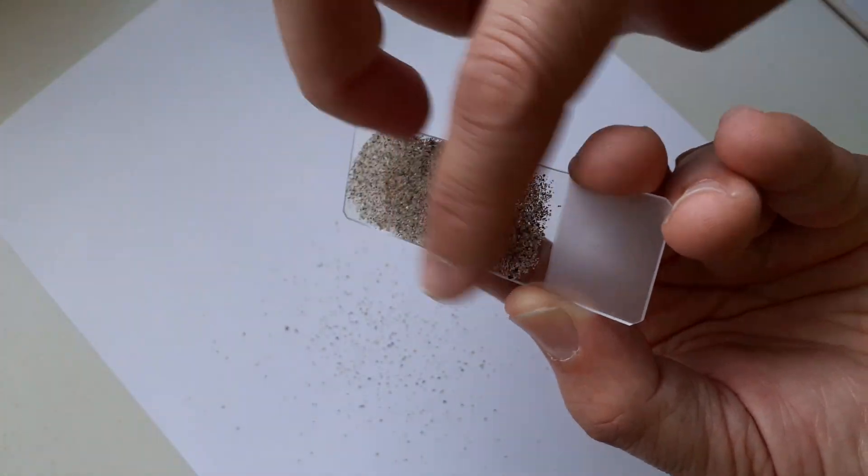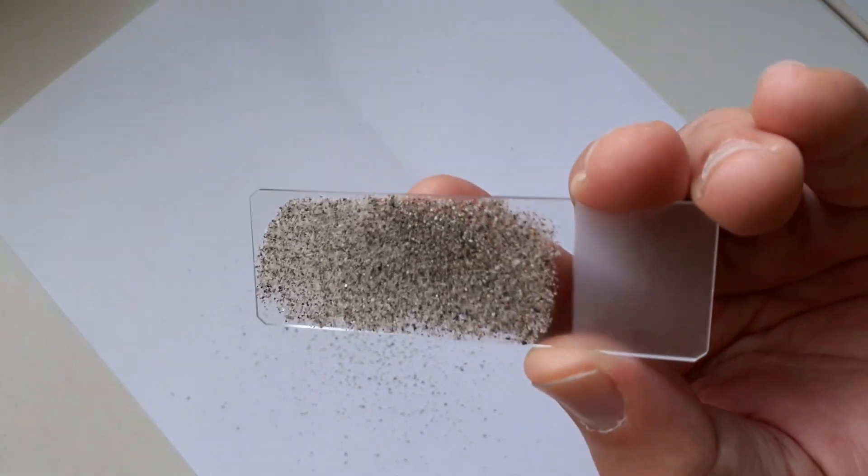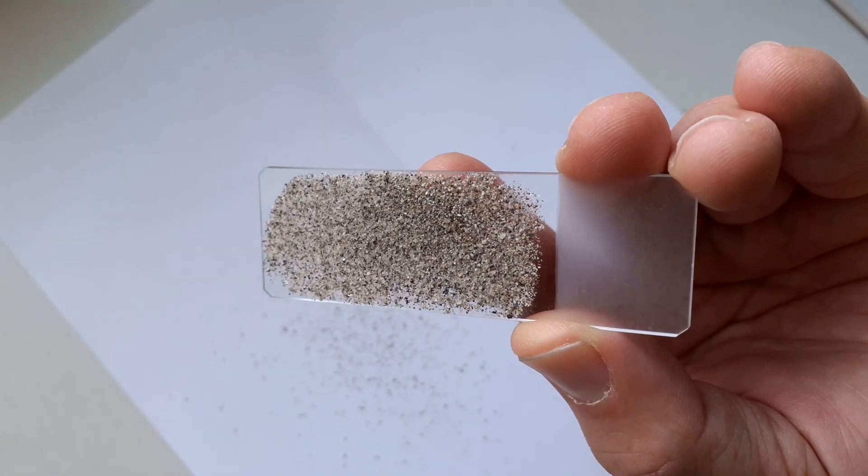So this is now after the drying time I was able to remove some of the sand. Yeah and it worked quite well, so I can imagine quite well that this is able to last for a very very long time.